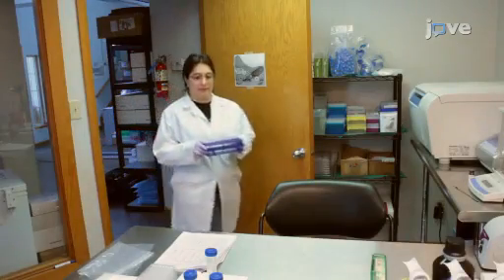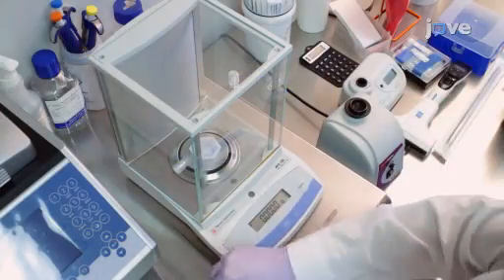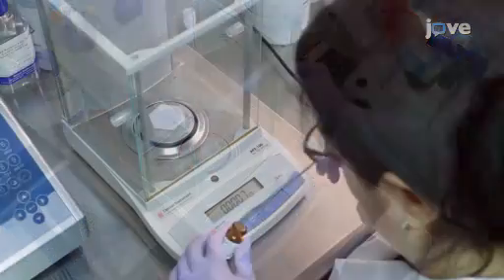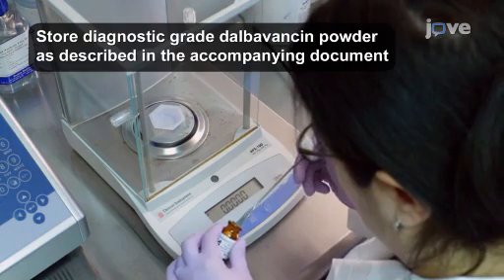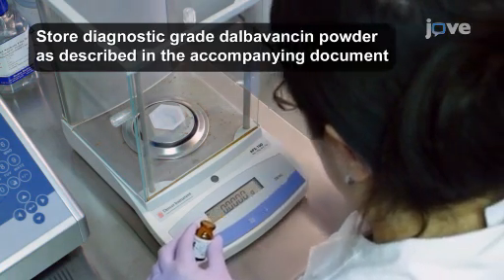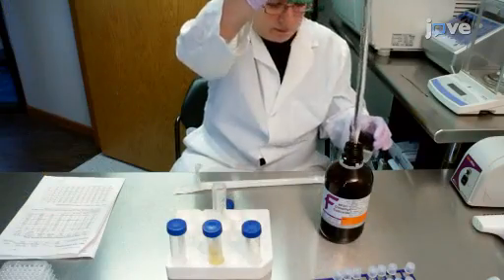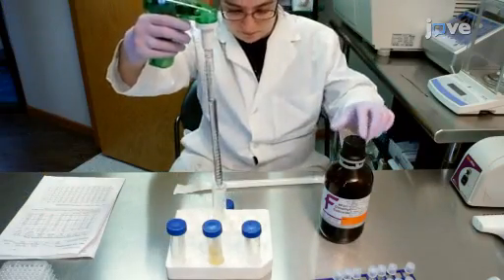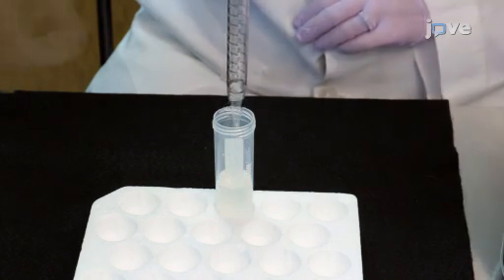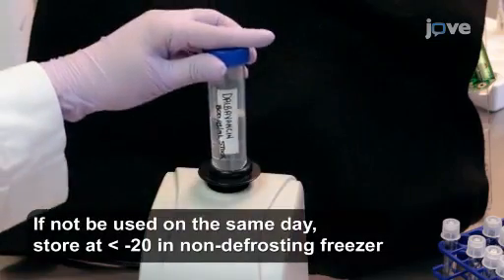Please note that appropriate safety precautions consistent with Biosafety Level 2 should be utilized when performing the following procedure. Begin by weighing out the appropriate amount of dalbavancin to prepare a stock solution of 800 micrograms per milliliter. Add the appropriate amount of neat DMSO to a sterile glass or plastic tube. Then, transfer the powder to the tube and vortex it.